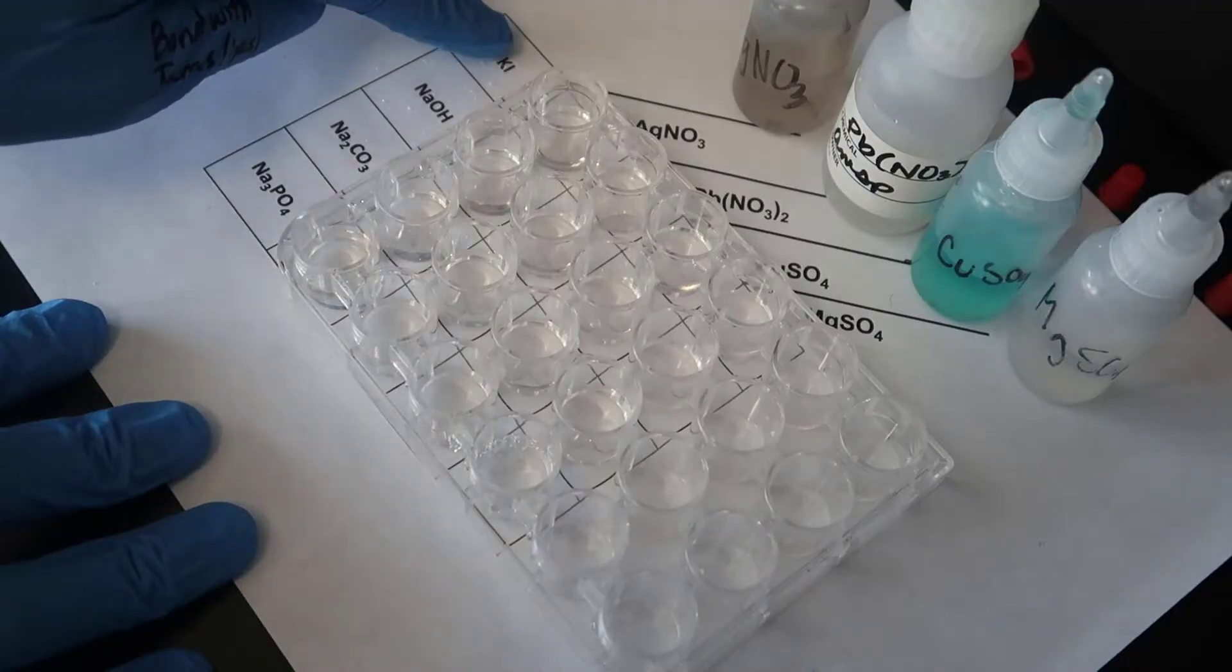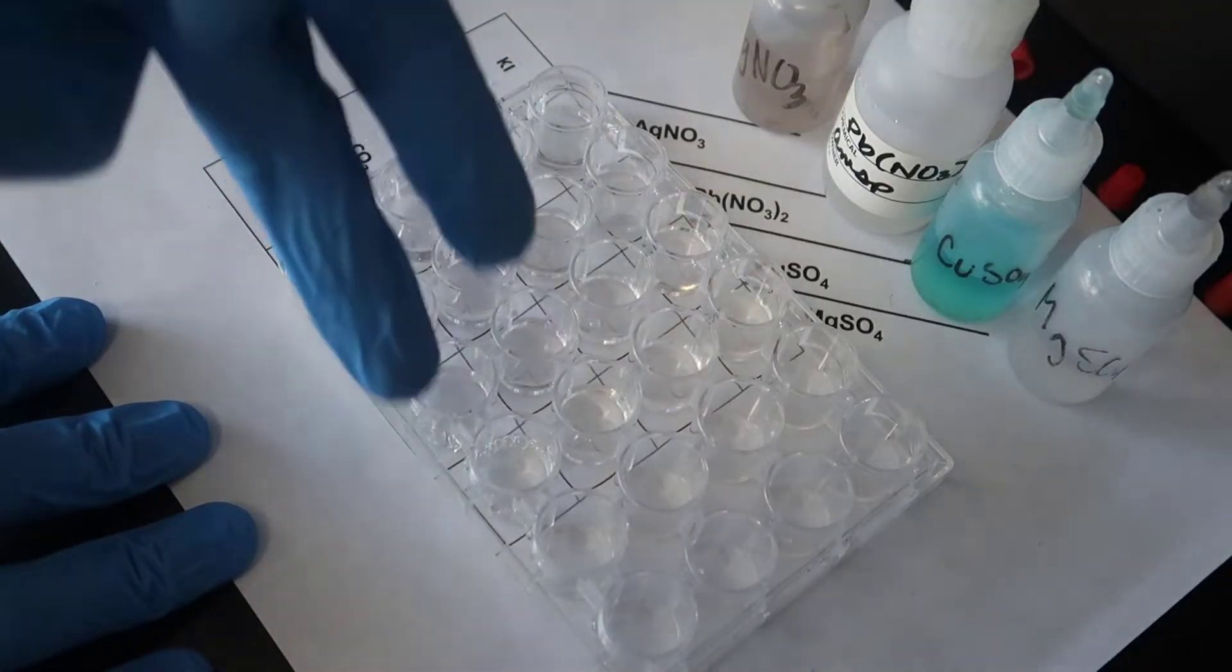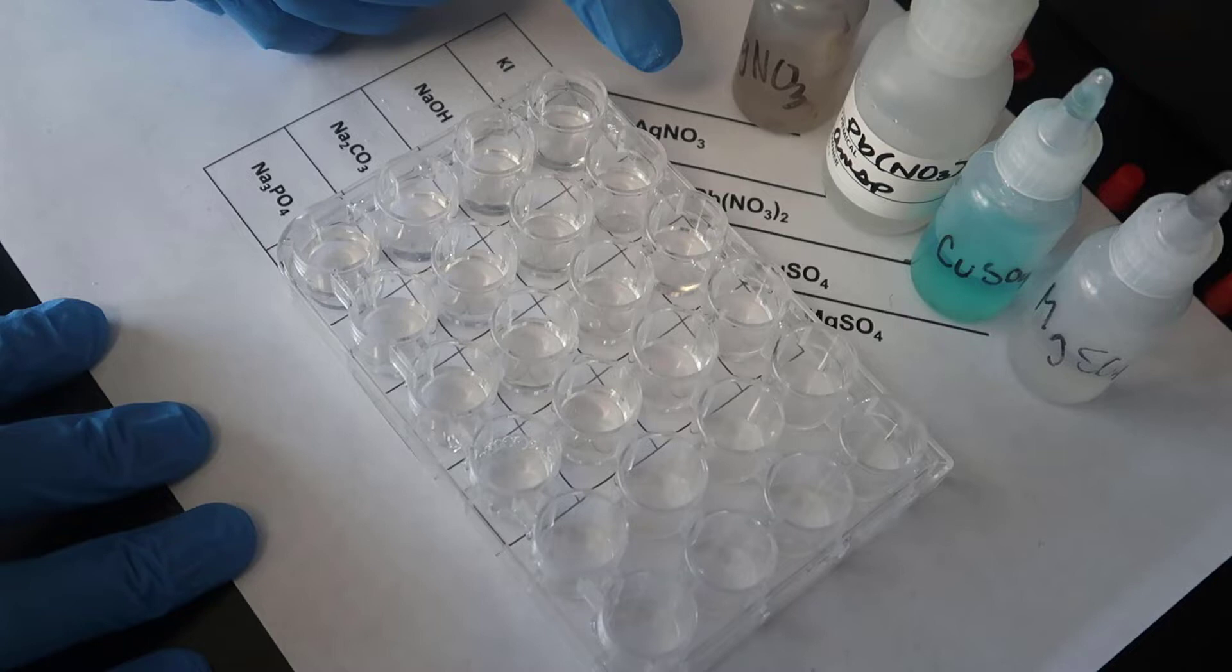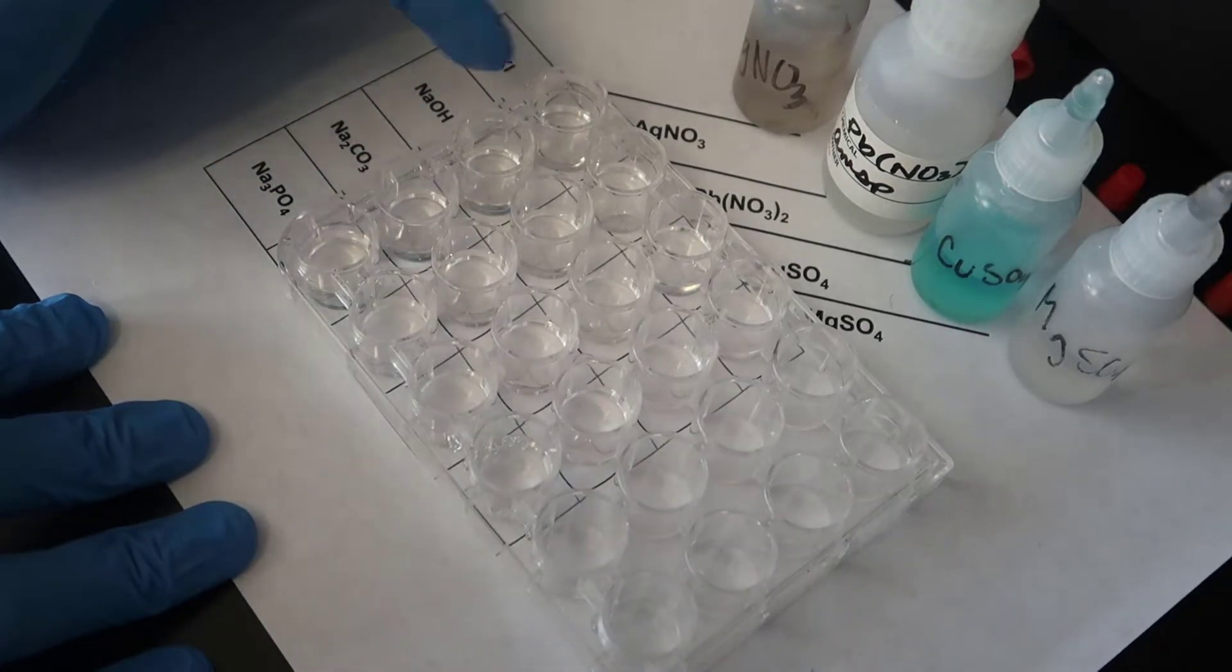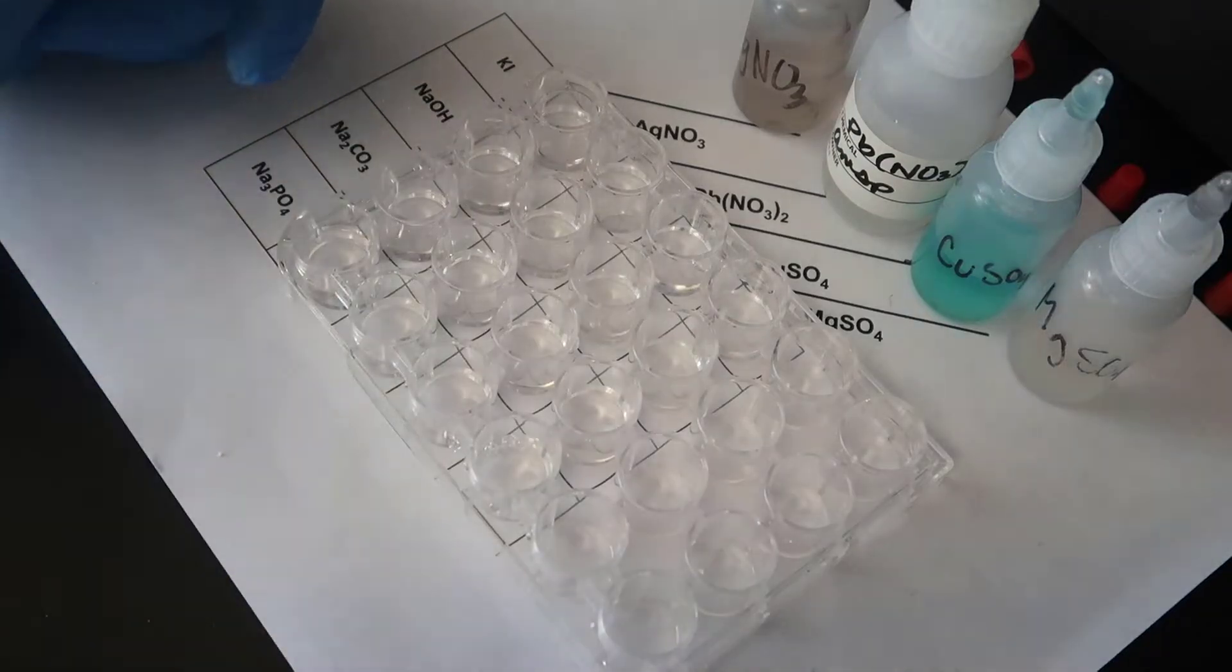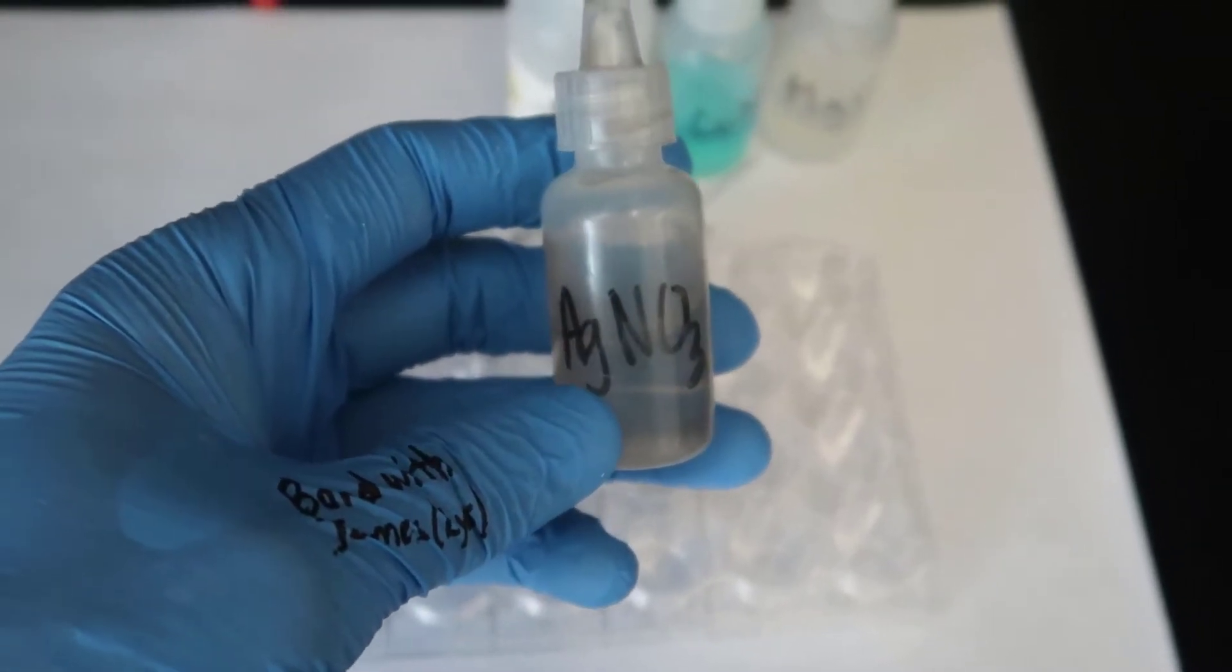So now that I have added these solutions across, I am going to take each of these and I am going to add them to the solutions going down. And then from that point you are going to record any observations that you notice. So first I am going to start with AgNO3, and I am going to add all the way down.